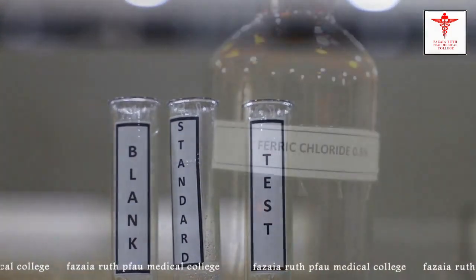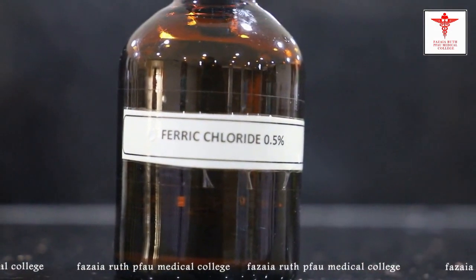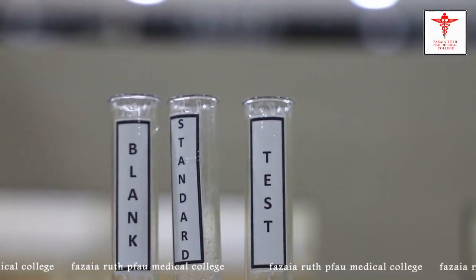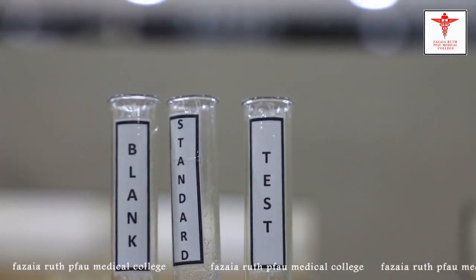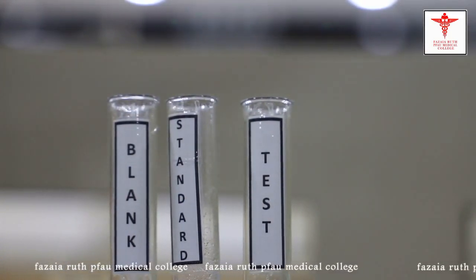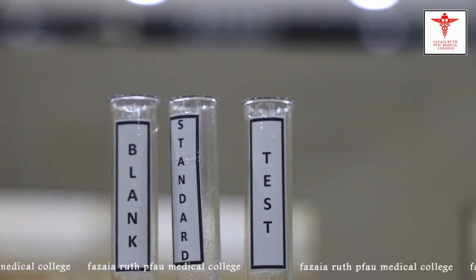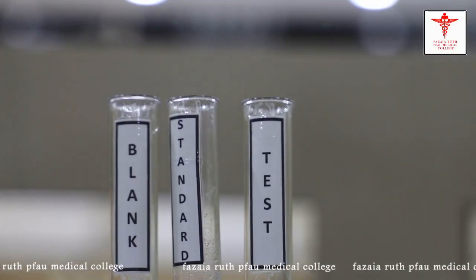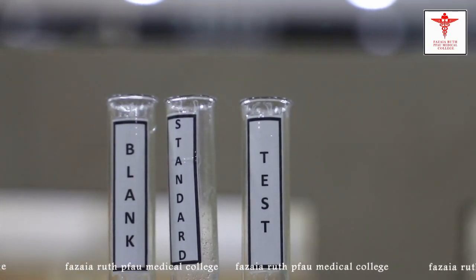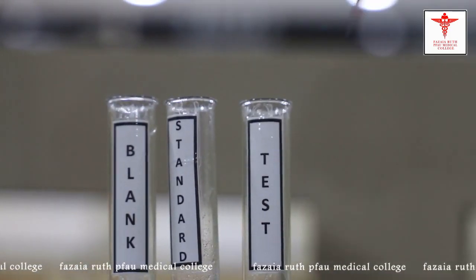The next step is the addition of ferric chloride. We will take 6 ml of ferric chloride and add it to all of the test tubes — the blank, the standard, and the test.